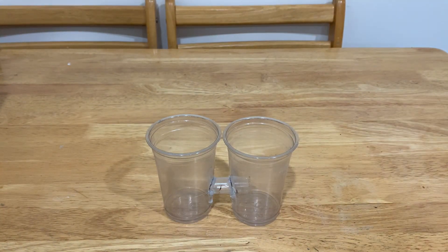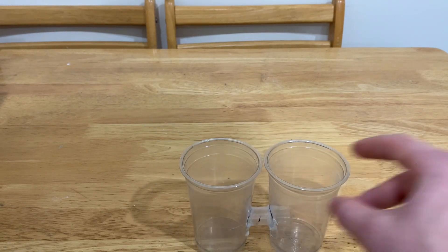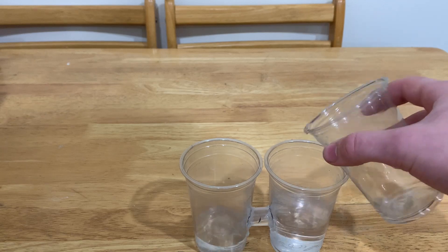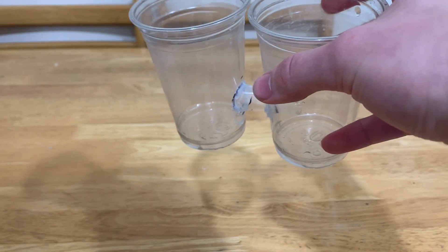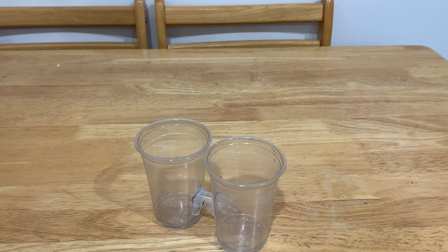What you will need for this process is an electrolyzer. Here is mine. I made this thing out of two cups and a pipe, all of which I had glued together at 2am while listening to Limp Bizkit. I cut a hole in the cups and passed the tube through them, so if I pour water inside of this thing, it flows through. The performance of mine is similar to me during a math test — we run for a while and then we break down. I'll probably be making another one in the future, but for now I will have to stick with this.